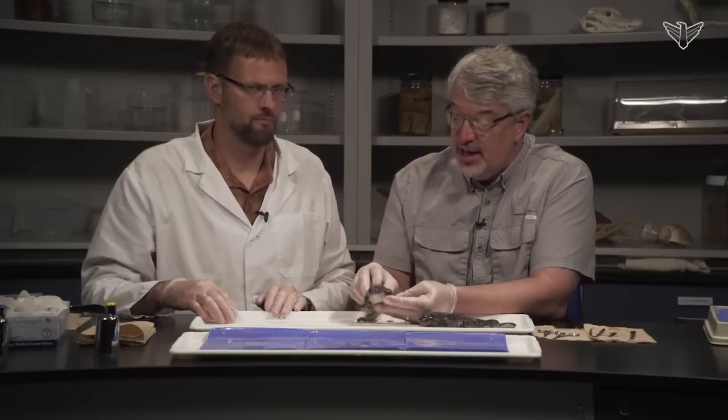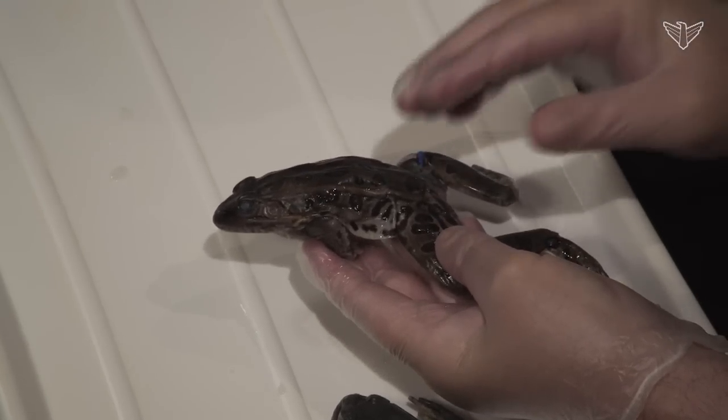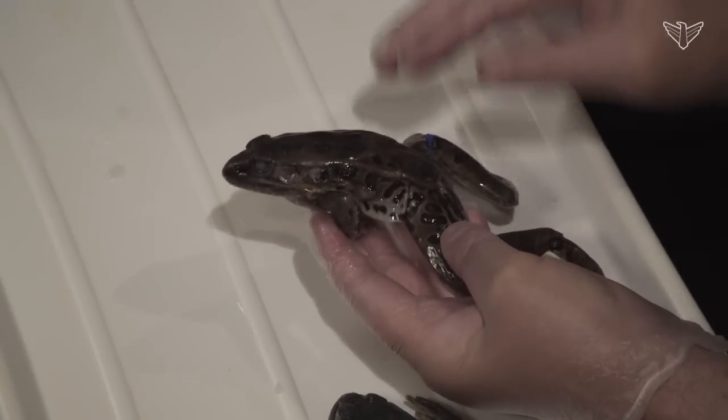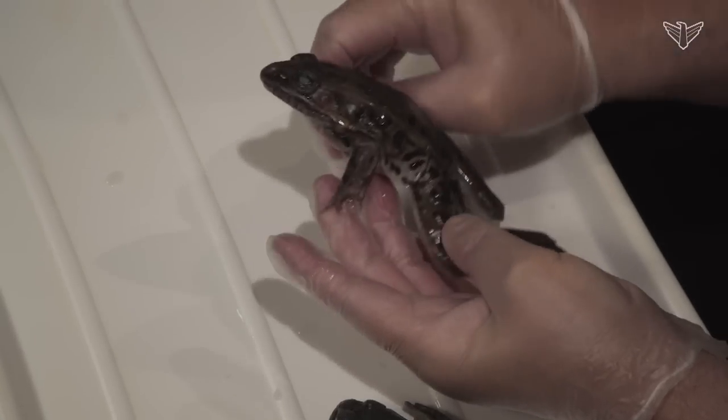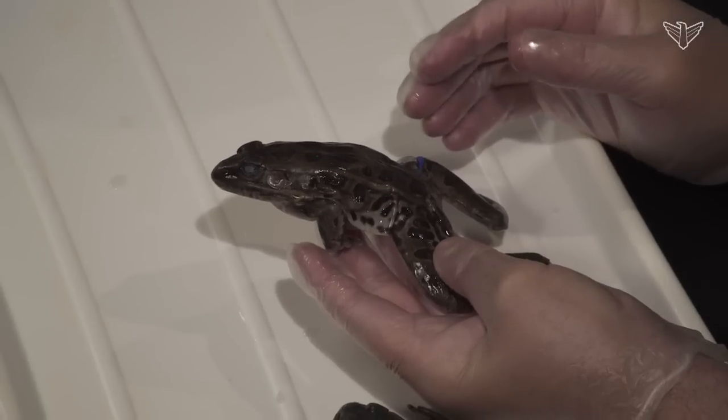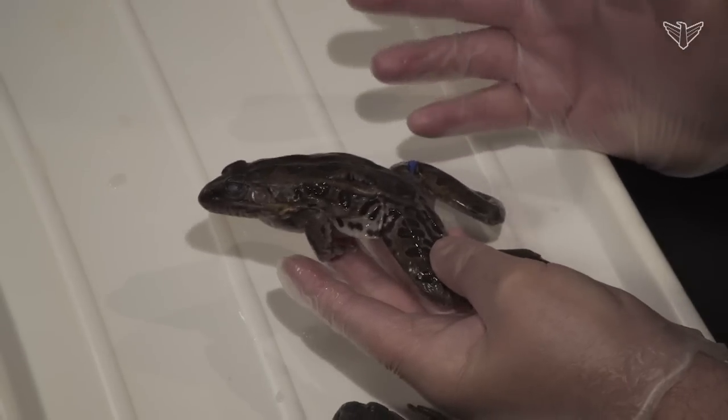Frogs are, as we did say, amphibians, and so they have a smooth, scaleless skin. The skin is actually moist because they use it as a respiratory surface. So frogs, unlike most other tetrapods — four-limbed animals — actually use their skin for one of the major sources of oxygen, as well as lungs, which we'll see later on.